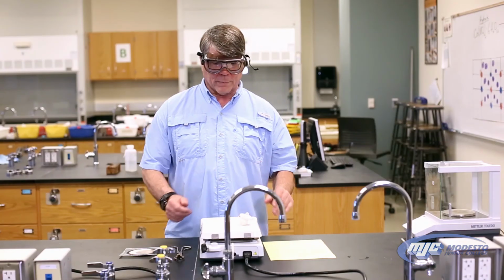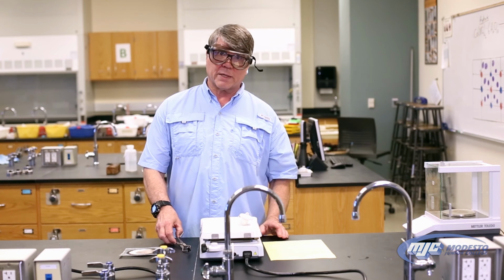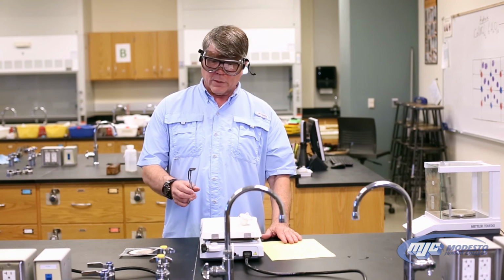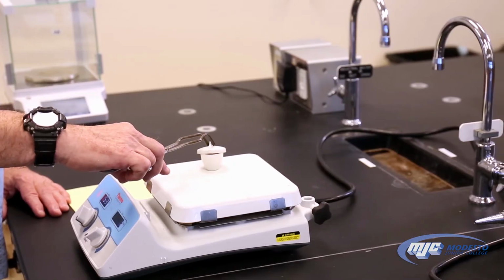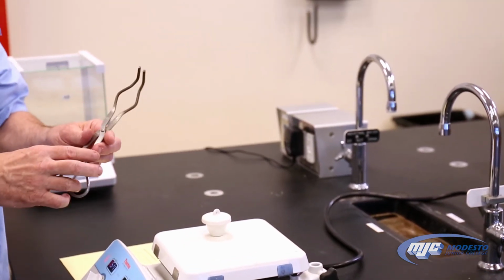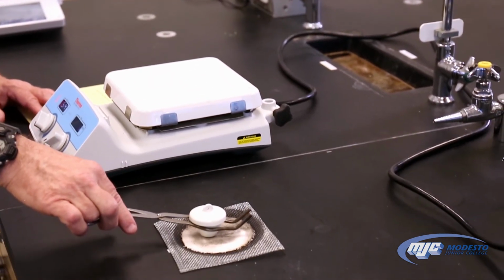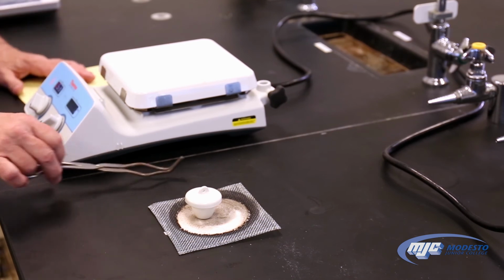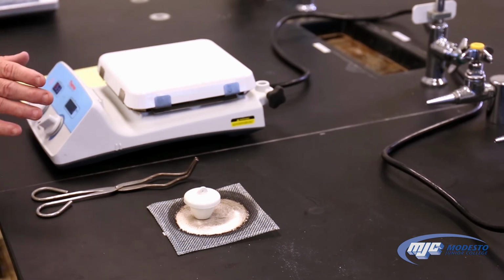All right, guys, so now your unknown hydrate has been heating up for a total of 20 minutes, 5 gentle and 15 strong. So we're ready to take the next measurement, which is going to be our A3. That's really hot, so we can't just touch it with our hands, unless we're Matt, but nobody's Matt but Matt. So we're going to take these crucible tongs, put the lid on the crucible, turn them over, use this opening right here that's made just for a crucible. Pick up the crucible, set it on this piece of wire gauze. We don't want to set it right on the countertop because sometimes that's kind of cool and that's really hot and it'll crack the crucible. So now we're going to just let that sit and become cool enough so that we can touch it without hurting ourselves. Then we're going to weigh it.